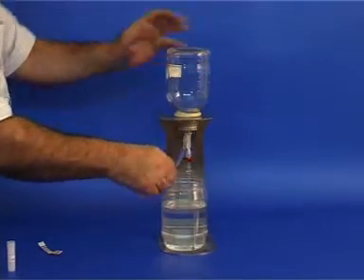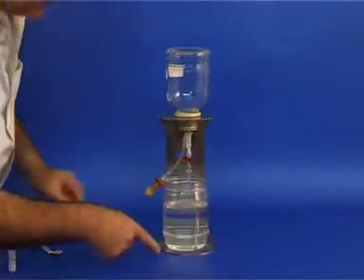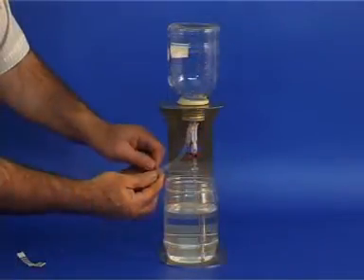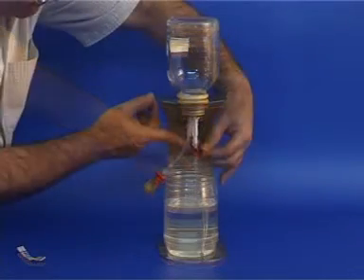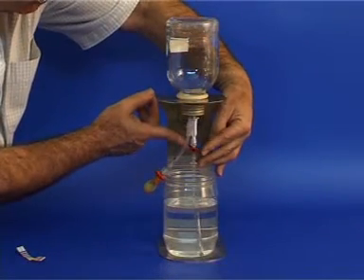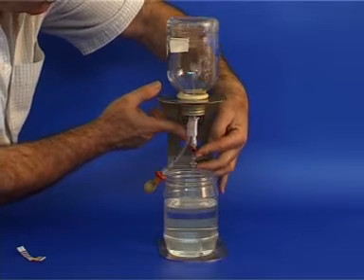Open the valve next to the syringe needle and squeeze the water into the glass bottle and close the valve. Now, open the valve connecting the tubing and the gas bottle and observe what happens. Note the red color.